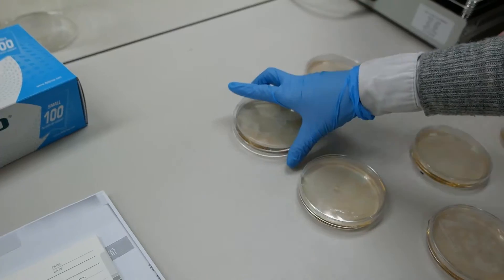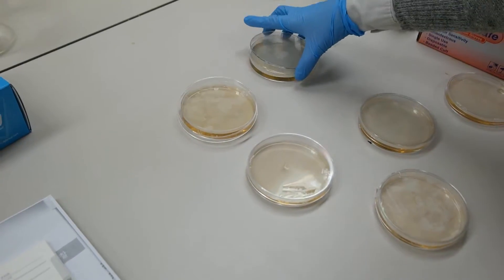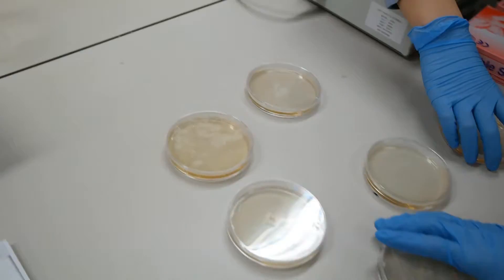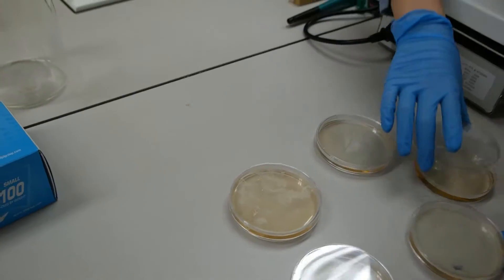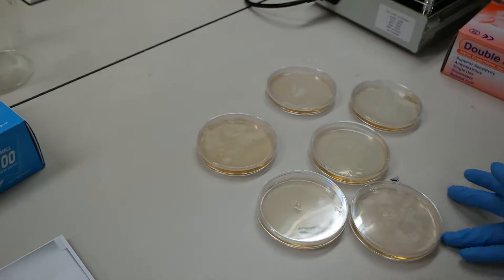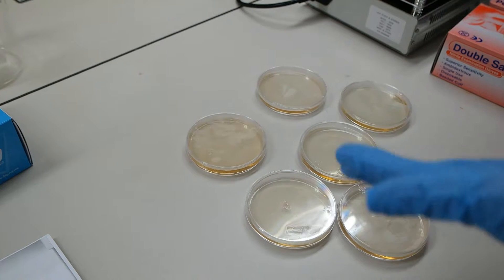Let's dip it. Let's spray it once more. I think it's okay to cover it now because it's not too hot. Let's dip it. We're gonna have to let it sit, and then we'll have to put it upside down and put it in the refrigerator. Okay, let's see now.